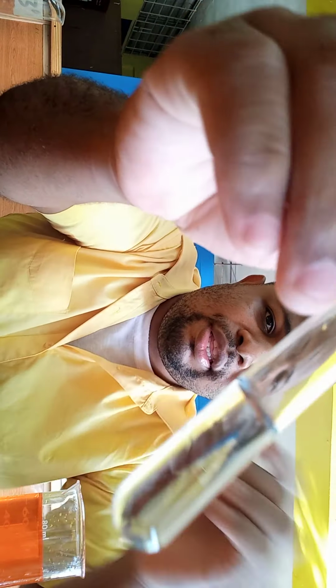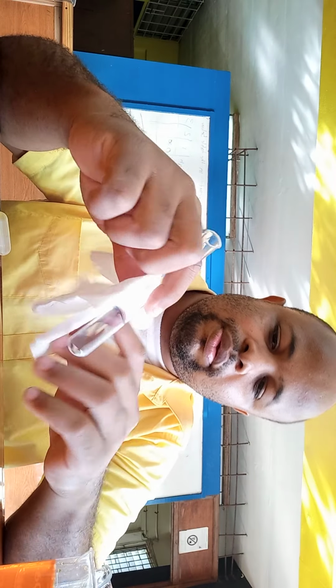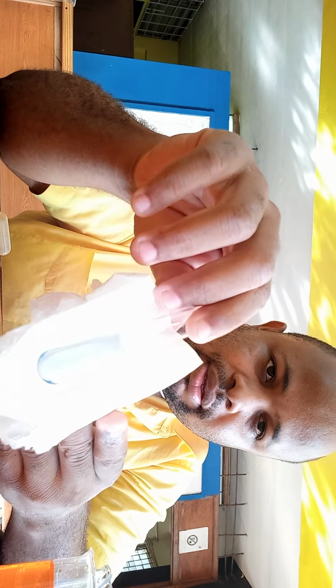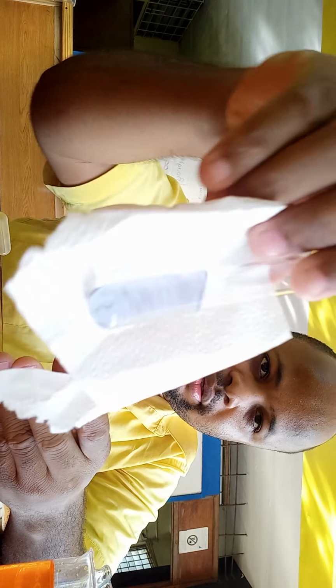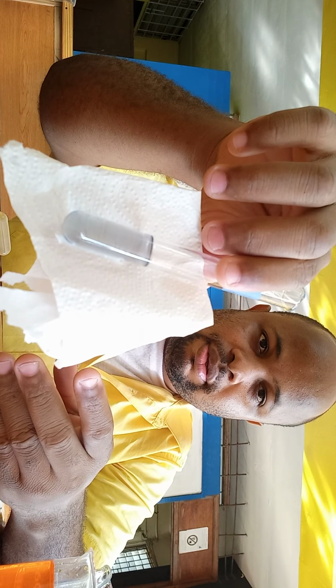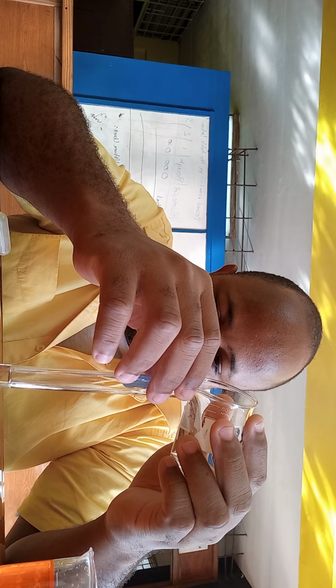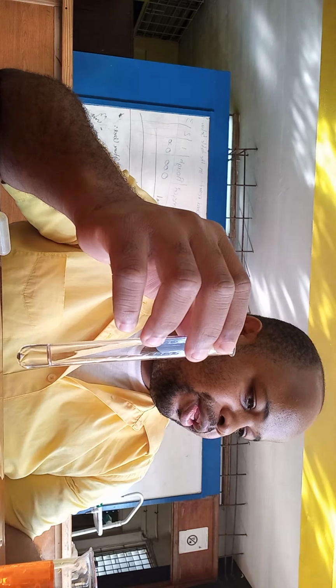Alright, so that one had ended by accident. So, right, let me get a white background. Alright, so this is actually looking more like a blue color, right? Then going to the green. Alright, and of course with alcohol B, we said it was the tertiary one, so we did not expect it to give any color change.